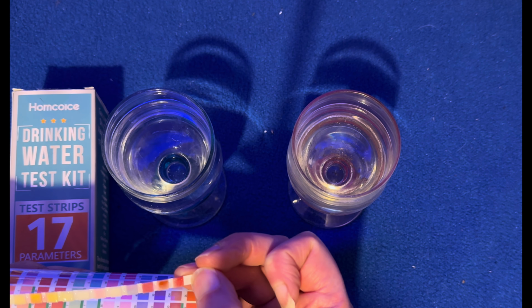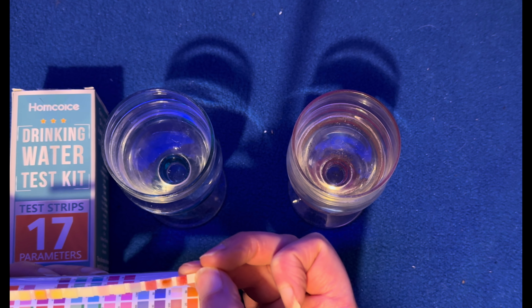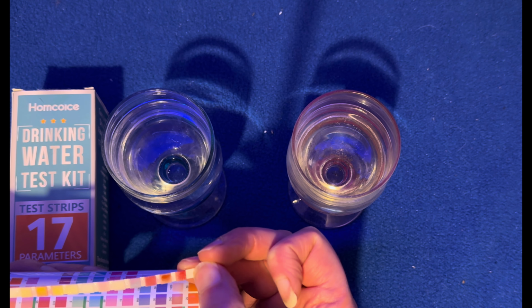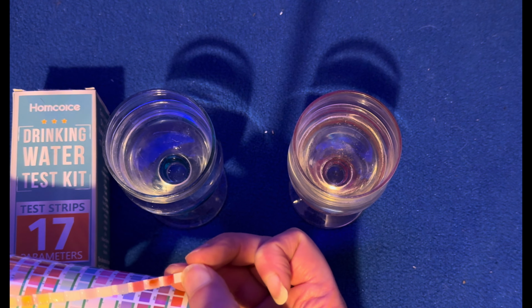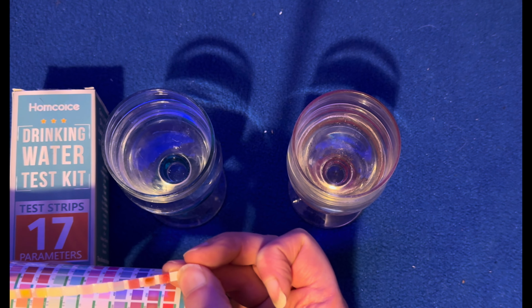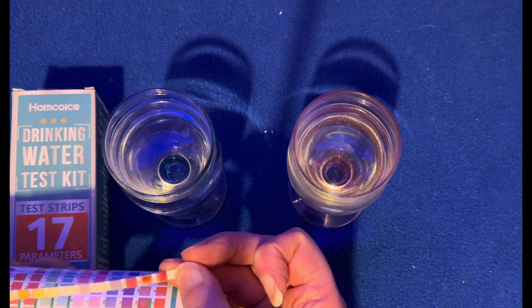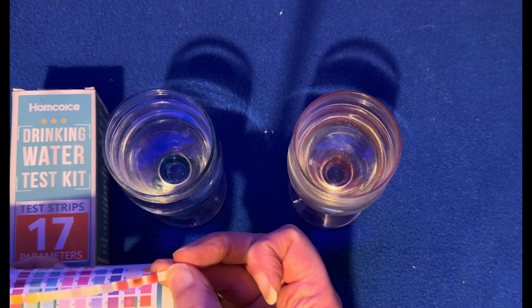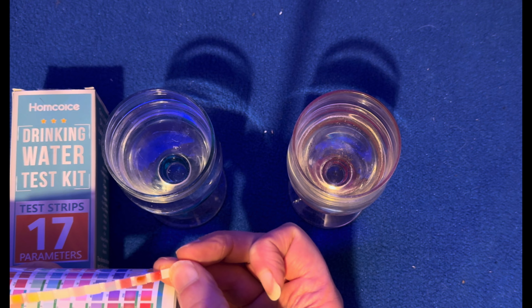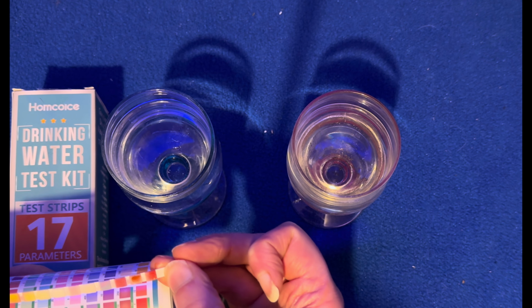Okay, so the next one along is nitrate. So we do have nitrates in there. There's about a third along, the 3 out of 5 along the scale of nitrates. Nitrite is negative. The next one is sulfate. So there's trace sulfate in there. No zinc. No salt, and no fluoride, so that's good.